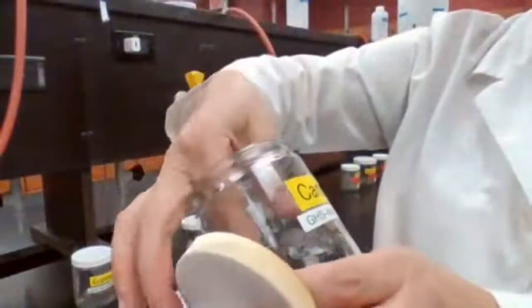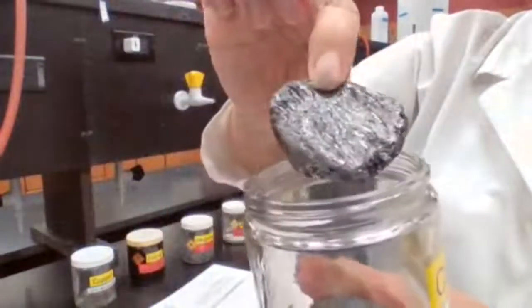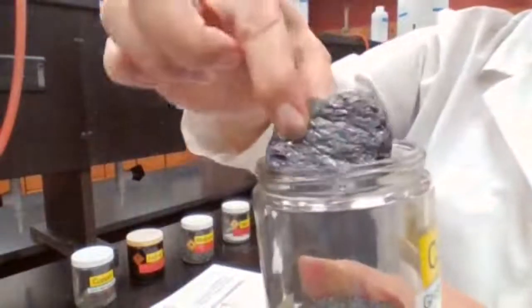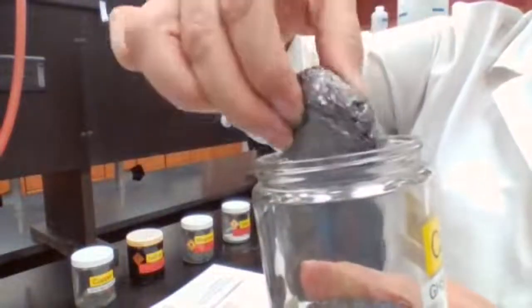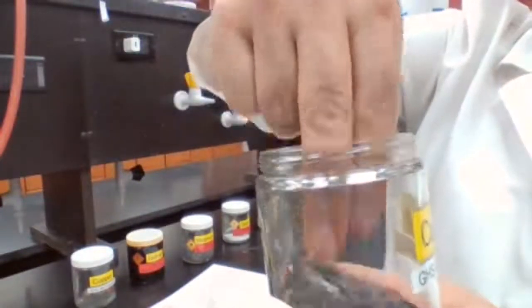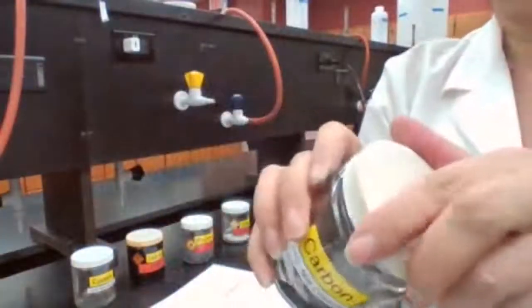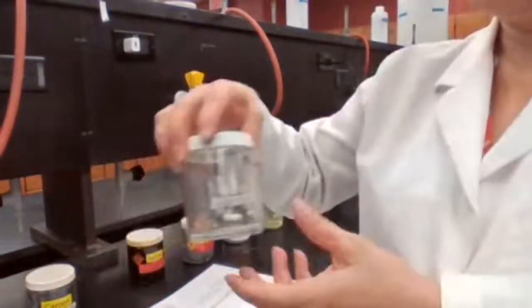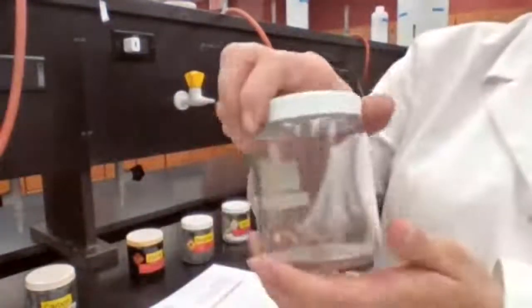Some elements are okay to touch, others are not. So I can touch this, bring it out for you to see it even better. This is the carbon in the graphite form. So it's the same thing that you have in your pencil. So you are looking at this element and recording your observation, basically the color and the texture and any physical appearance that you would see. Is it shiny, is it not shiny, what does it look like to you?